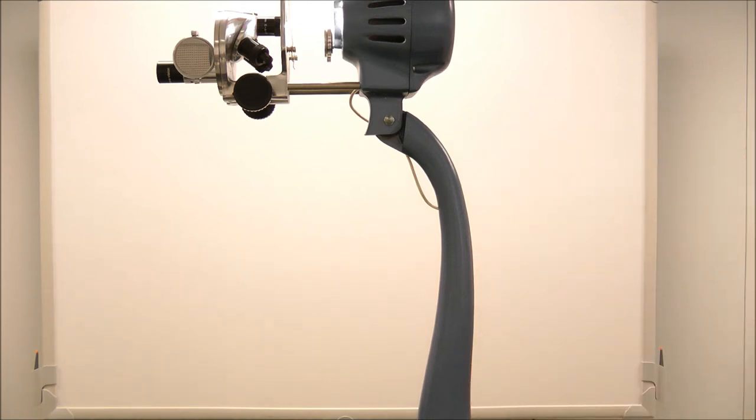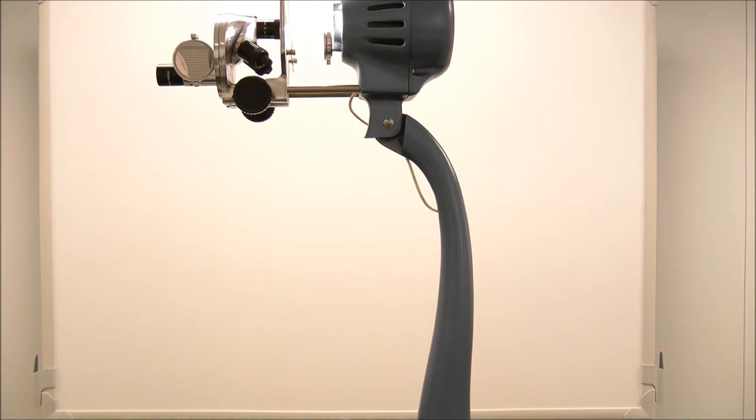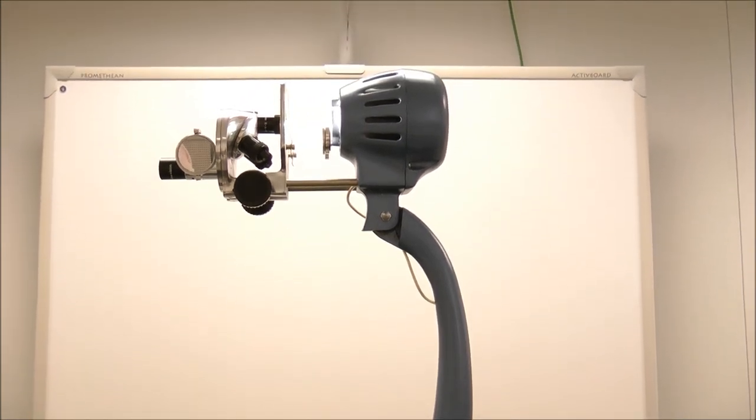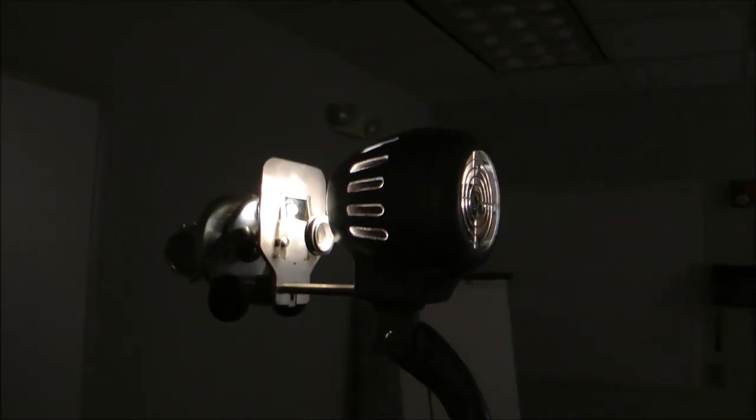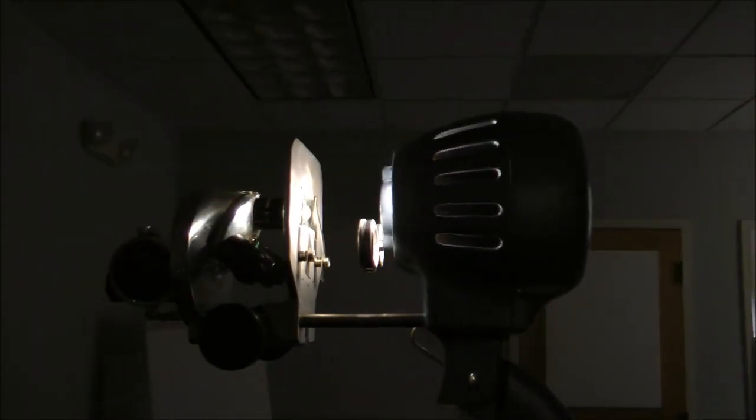Just below the hinge point, you will be able to raise the head very smoothly. You do not have to force anything. Be sure the mirror is out of the way of the light beam coming straight through the stage and going to the screen or wall on which you wish to project the image.